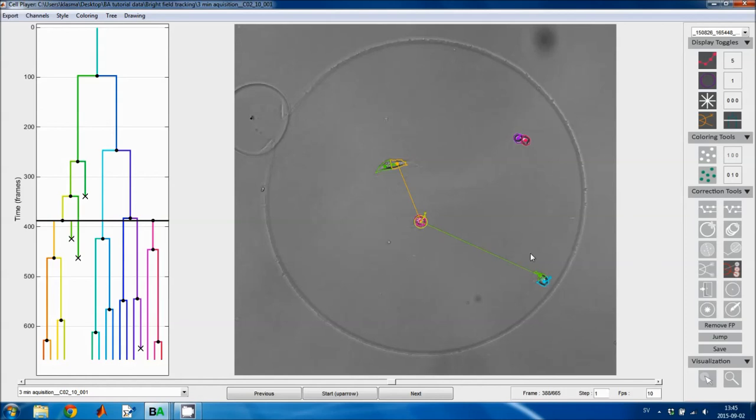And this tool is useful because oftentimes when you miss a cell division, you also get a cluster of two cells. So then you duplicate the cell which represents the cluster, and then you introduce the daughter cell inside that cluster.